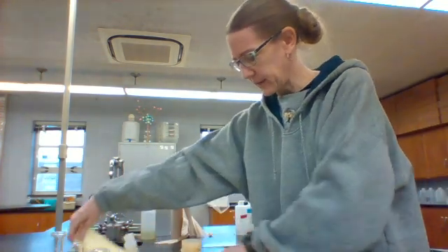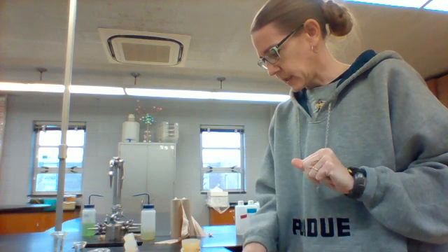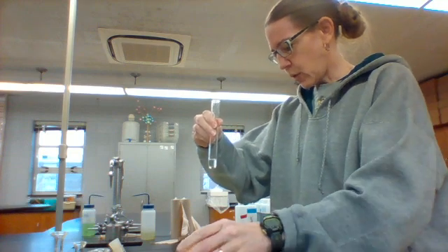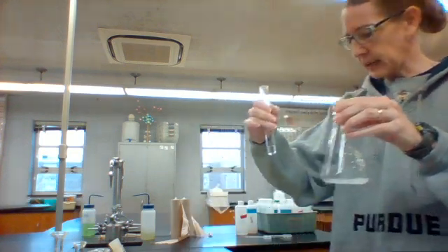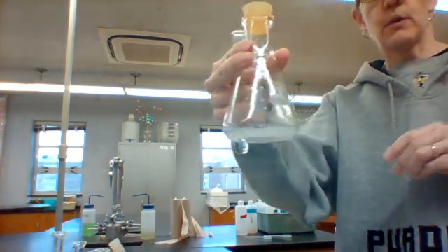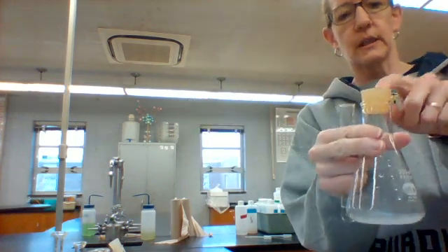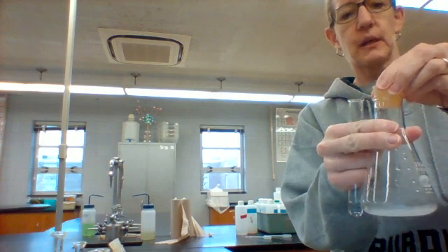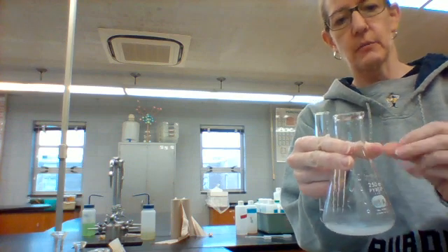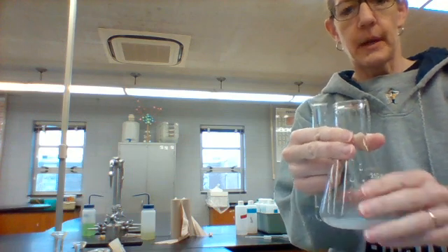Now we are going to take our other test tube. We are now on step 7. We're going to pour that into our flask. It says here in big bold letters, all caps, leave the stopper off. If you don't know what to expect here, we should be seeing some bubbles, because the reason we wouldn't want to leave the cork on is if enough gas builds up, this cork will blow off. I have actually had students not read the directions, and that has happened before. It's more for safety purposes that we don't leave that on.